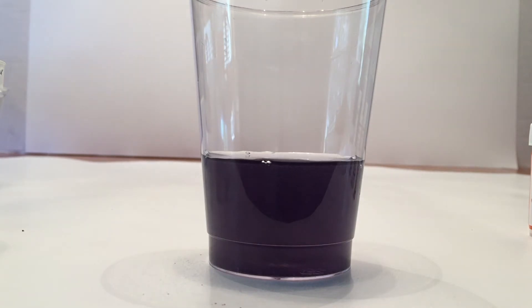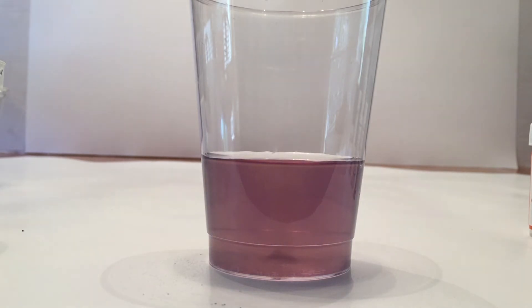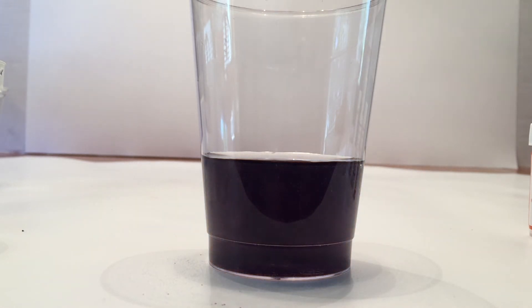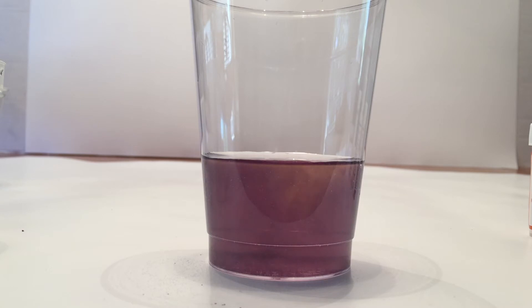It's a dark black. It's an iodine, which is pretty cool. So we switched to color, but it's going to continue to do the cycle. Now it's going back to orange, which is pretty cool. And then it's going to go back to a dark purple again, just like that when it switches pretty quick. And then it keeps rotating through, which I think is completely awesome. It'll continue to do this multiple times before it stops. And it's just incredible.